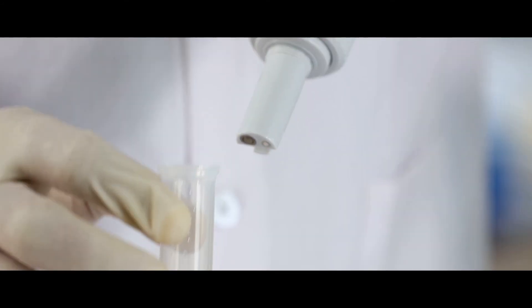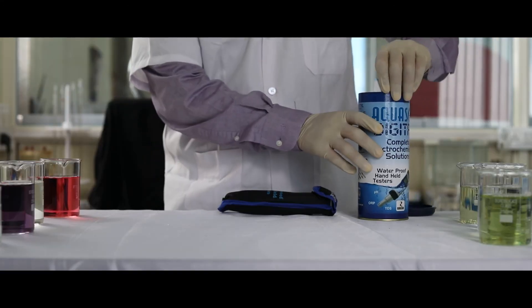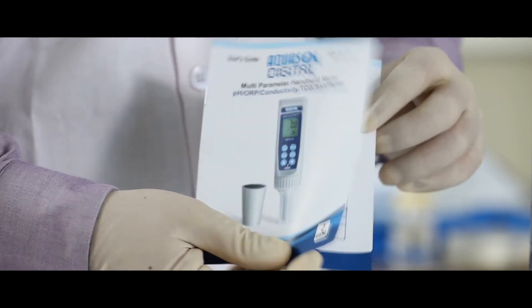Make sure the electrode protection bottle is wet with soaking solution. For better understanding of this product, please refer to the product leaflet provided.